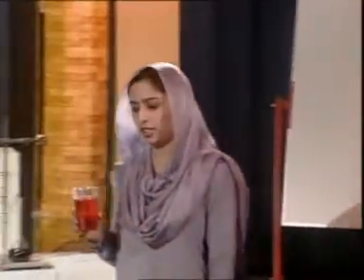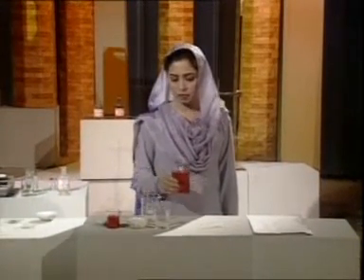Different people drink different types of drinks. Here I have one drink in my hand. Let's see whether it is a solution or not. Actually, this drink is made from sugar, syrup and water. Let's make this solution here.